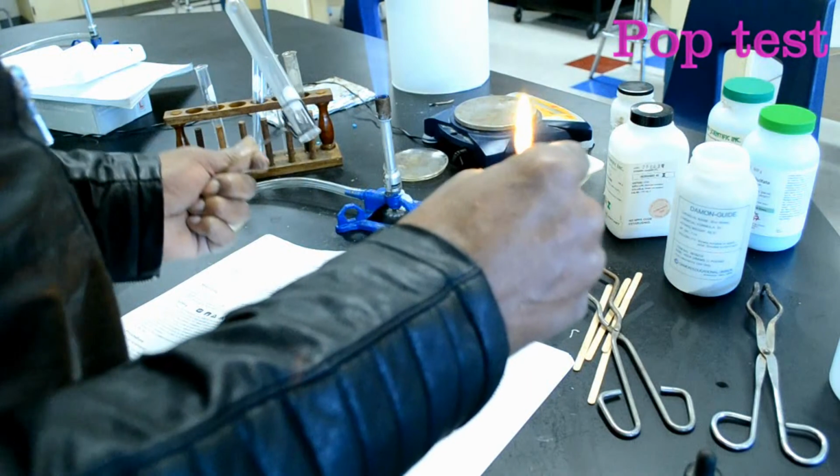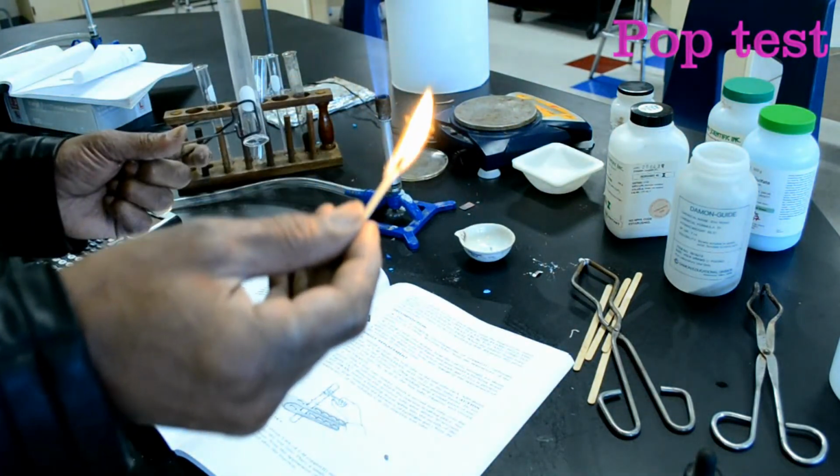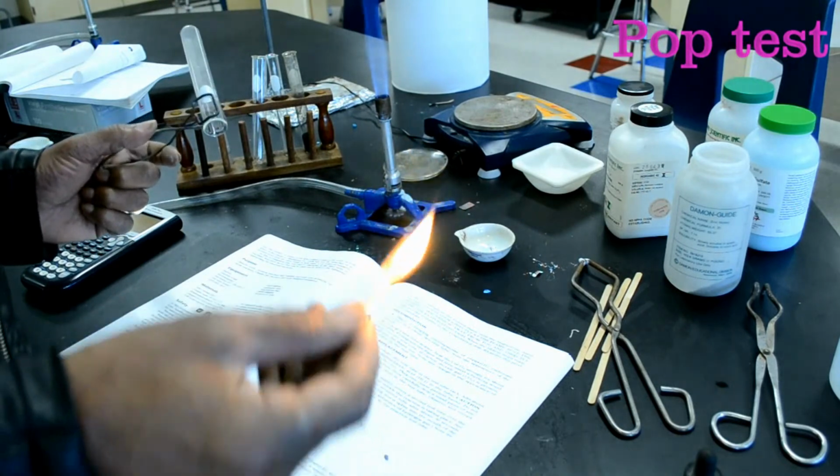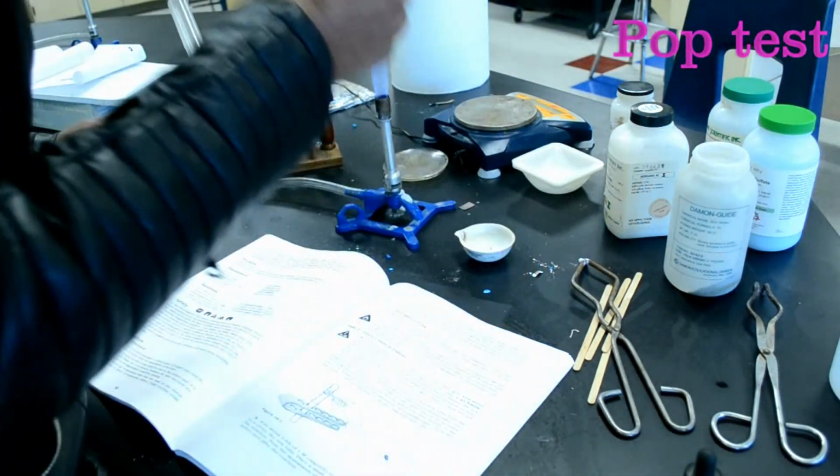Whoa. So we definitely got a pop. This is actually called a pop test that actually confirms the presence of hydrogen gas.